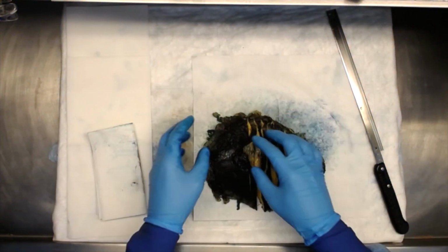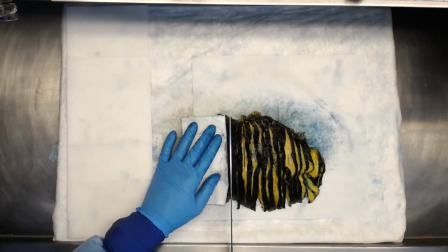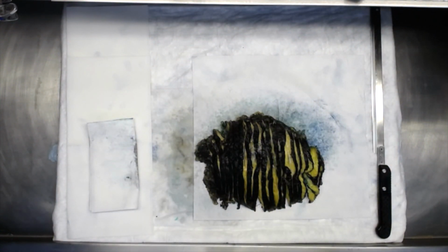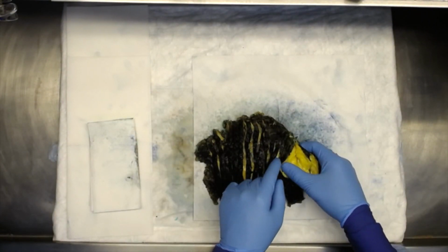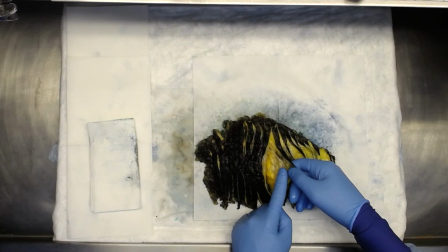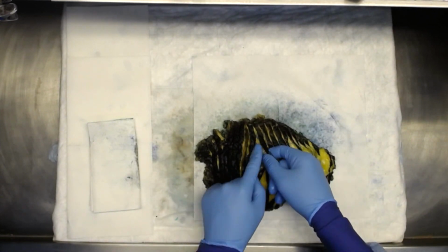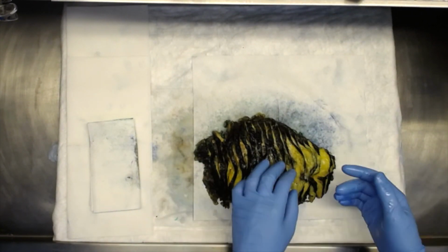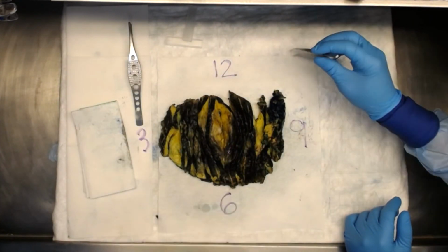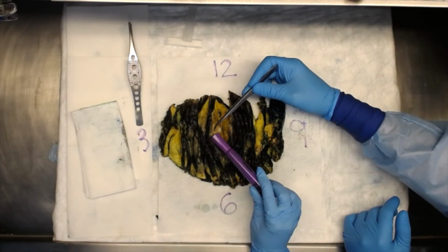It is important to always be familiar with the patient's history before taking sections for histology. This includes looking at all imaging reports and prior pathology reports, such as biopsies. With this information, you will know the size and location of all potential lesions to be sampled, as well as the presence of any biopsy clips. Use the Faxitron X-ray device to locate any difficult-to-find biopsy clips.